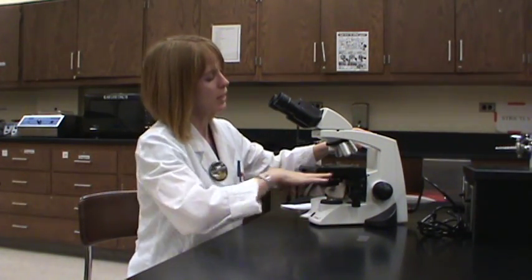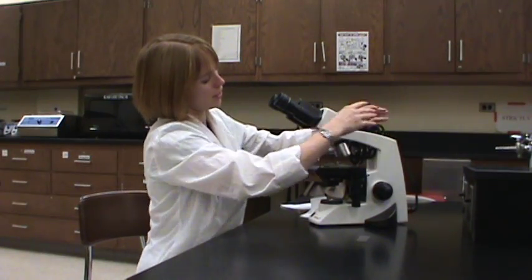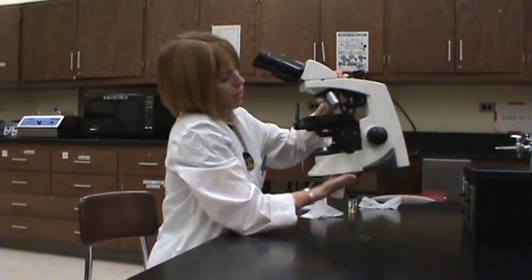The reason we want to do this is because mascara is a little sticky and it can stick onto the surface of the ocular lenses and become difficult to view through. When you're done, we've wiped all the lenses. If you accidentally dripped oil somewhere else, you're going to want to wipe that off with a little bit of lens paper too. Go ahead and unplug the microscope, wrap the cord up — they have nice little slots here for the cord, so put the cord back. Then you're ready to carry your microscope over to the cabinet. Make sure you carry it with two hands: one hand underneath the base and one hand on the arm. It's going to go into the cubby hole with the ocular lenses facing out in the properly numbered slot.